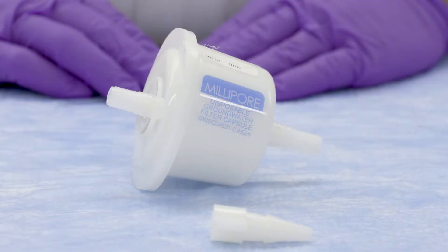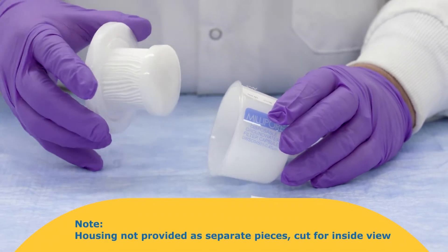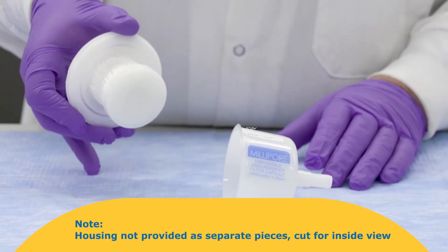On the exterior of the capsule there's an inlet and outlet side. If you were to look inside you would see pleated membrane format in a cartridge type design.